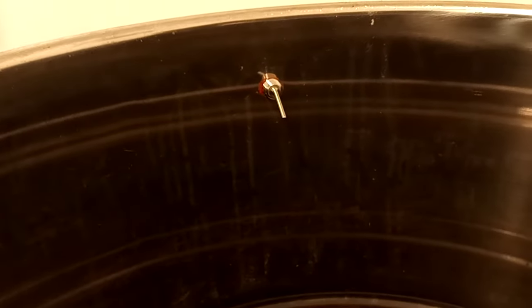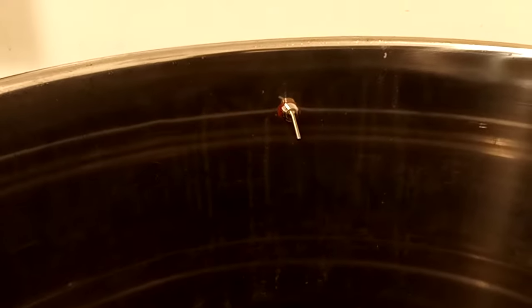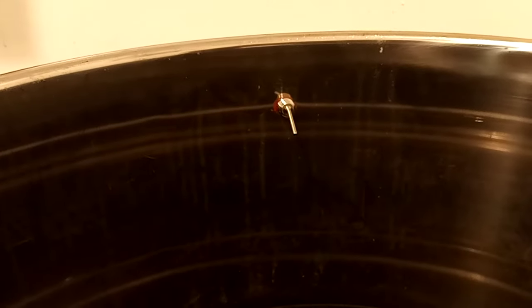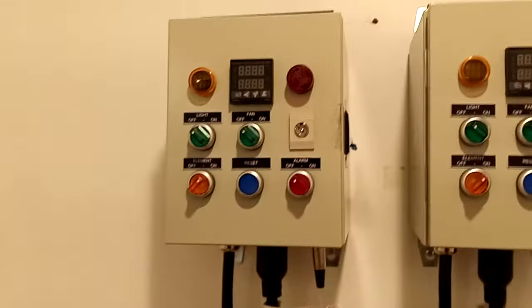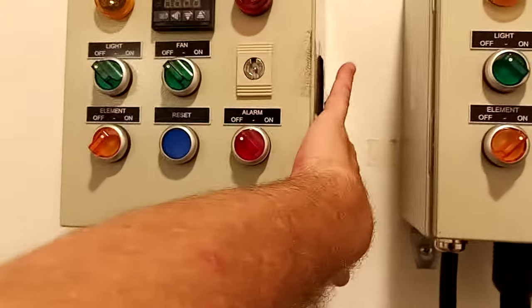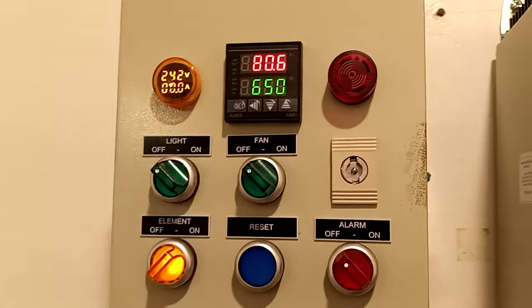You'll see here — it's a little bent — but this is our temperature sensor. We have temperature sensors at the top of these barrels that sense the temp up there, and we use that just to regulate the temperature. We've done a lot of tests; we run them at about 180°F, and once it gets up to 180 it holds for a specific amount of time using these machines, which were initially designed for powder coating.